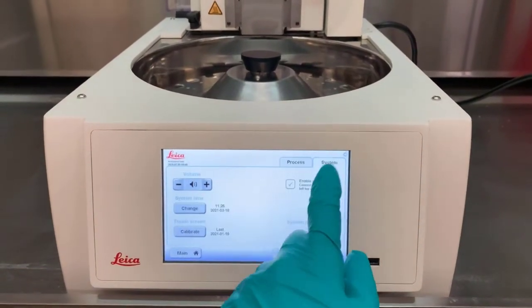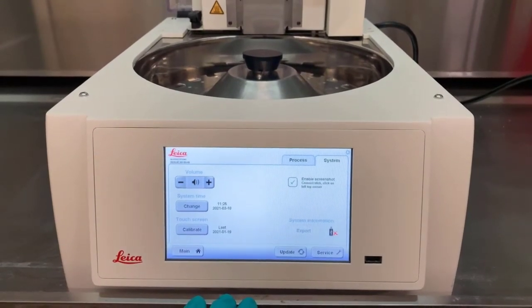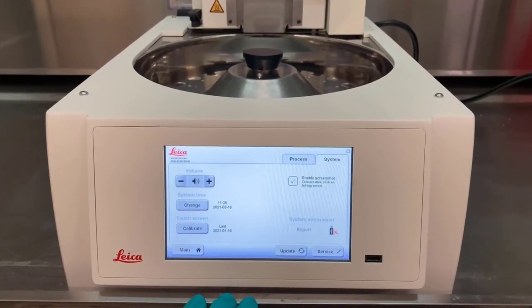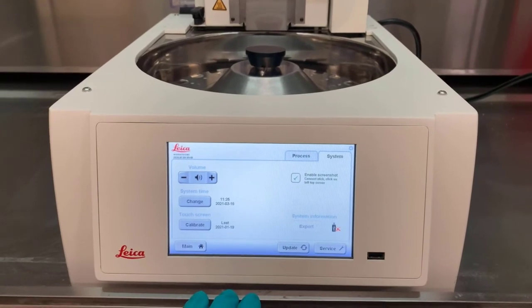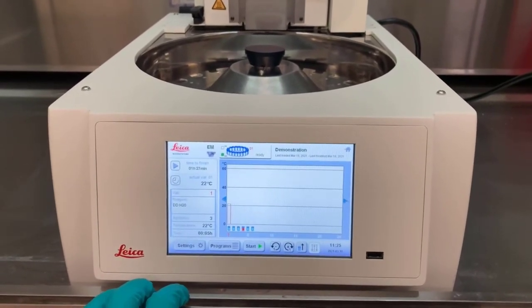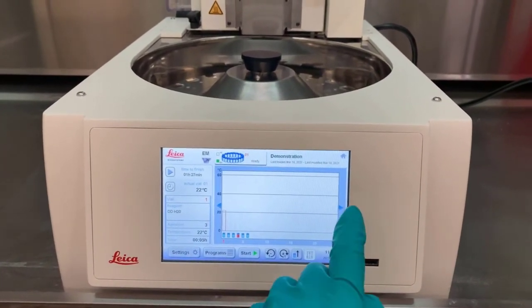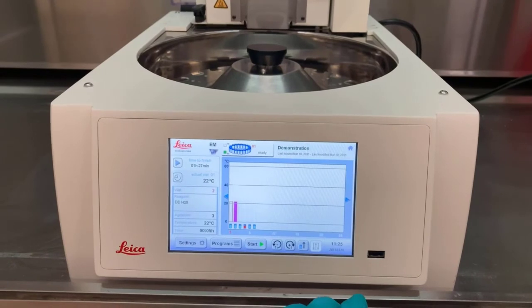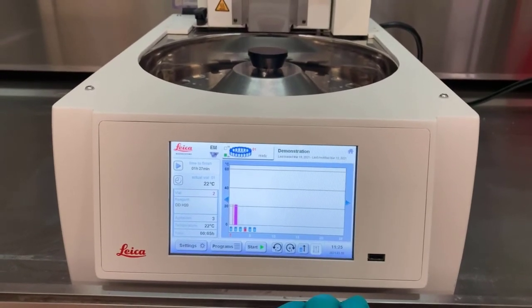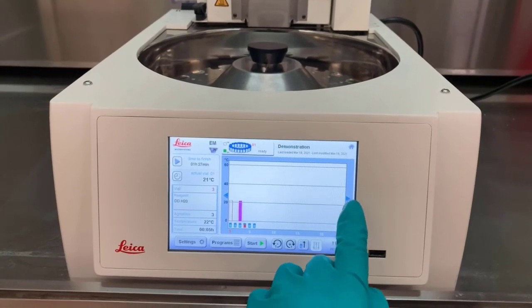The tab on the upper right, System, allows volume to be changed, as well as enabling screenshot mode, for which screen images can be taken of the screen by tapping the upper left-hand corner. The last button is Start, in the middle of the bottom. It will step through the program, beginning it and carrying out the program you created as part of using EMTP.